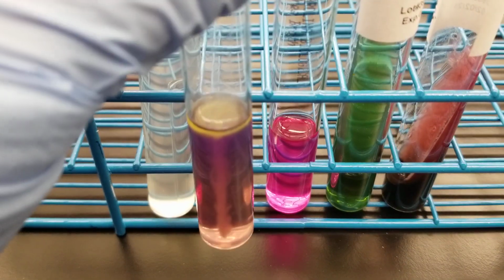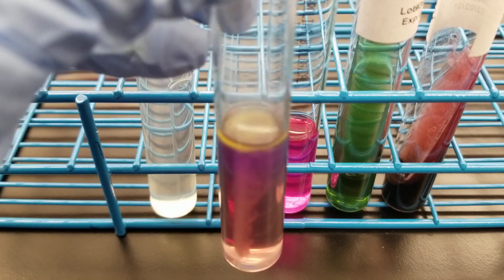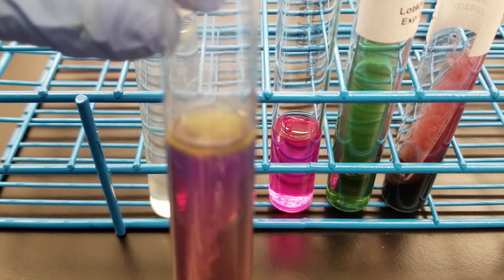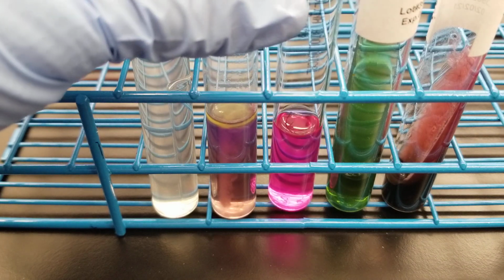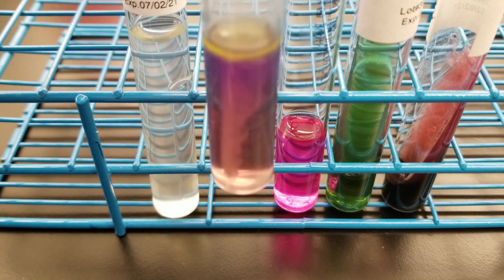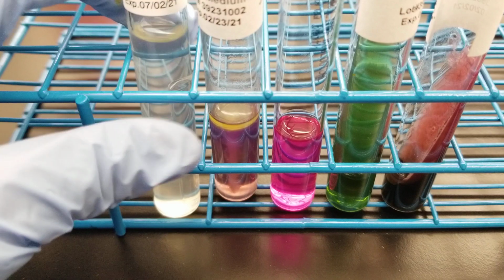That has been seen before in our lab, so that's probably what's happening here. I think I got that out of our textbook too, that might end up happening, even though it doesn't say variable positive. So check that out. It may just be the strain that we have. We'll see. Or, you know, it may be different for you.